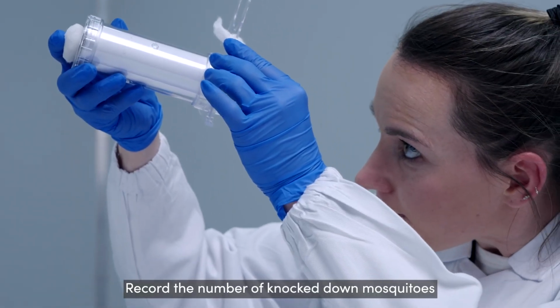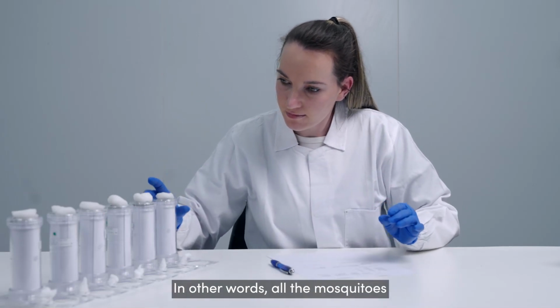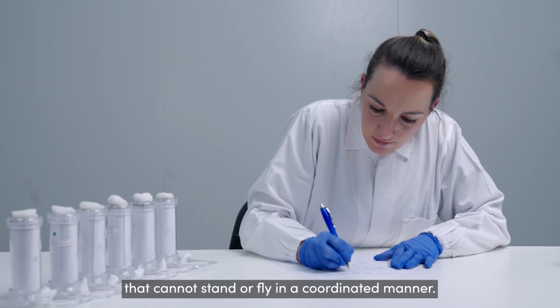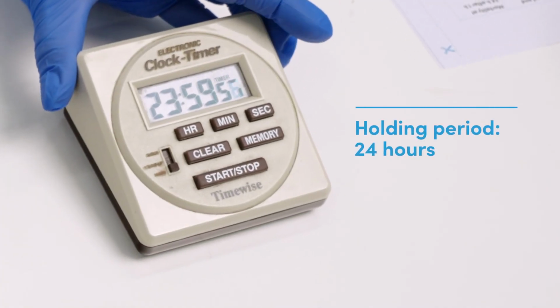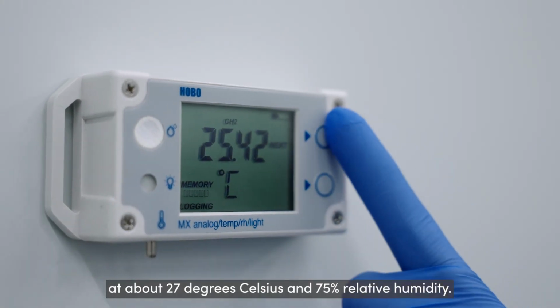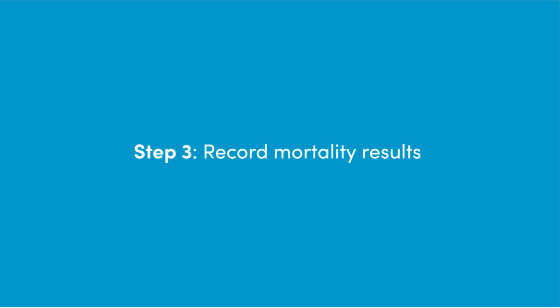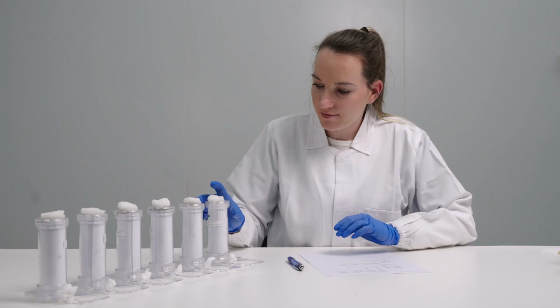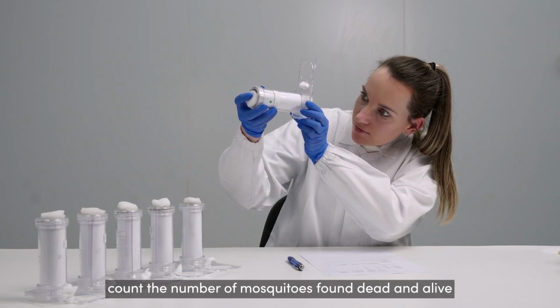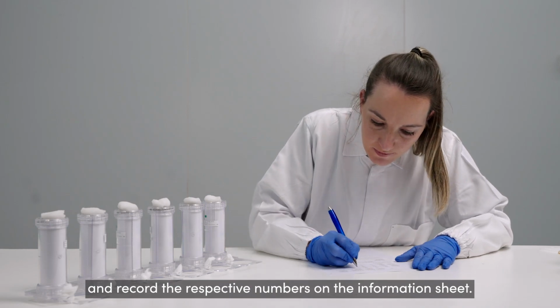Record the number of knocked down mosquitoes after 1 hour exposure. In other words, all the mosquitoes that cannot stand or fly in a coordinated manner. Hold the mosquitoes in the holding tubes for 24 hours at about 27 degrees Celsius and 75% relative humidity. At the end of 24 hours, count the number of mosquitoes found dead and alive and record the respective numbers on the information sheet.